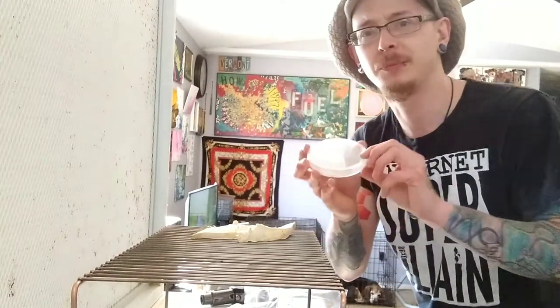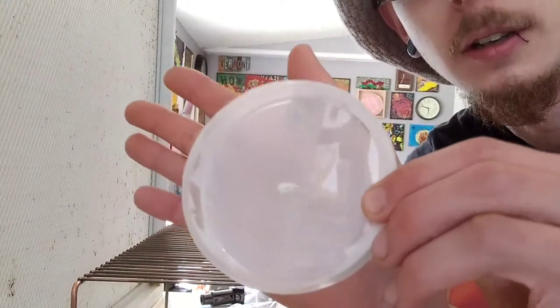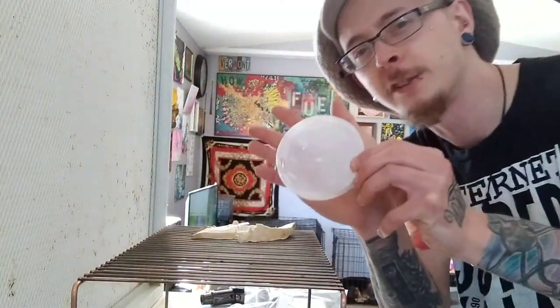It took me two pieces of parafilm because I'm a newbie and I really don't know what I'm doing. But we now have our petri dish with our piece of mushroom tissue on the inside. It's been sealed, and we're going to allow that to sit at room temperature for a couple of weeks and allow it to colonize. I'll let you guys know how it's going.